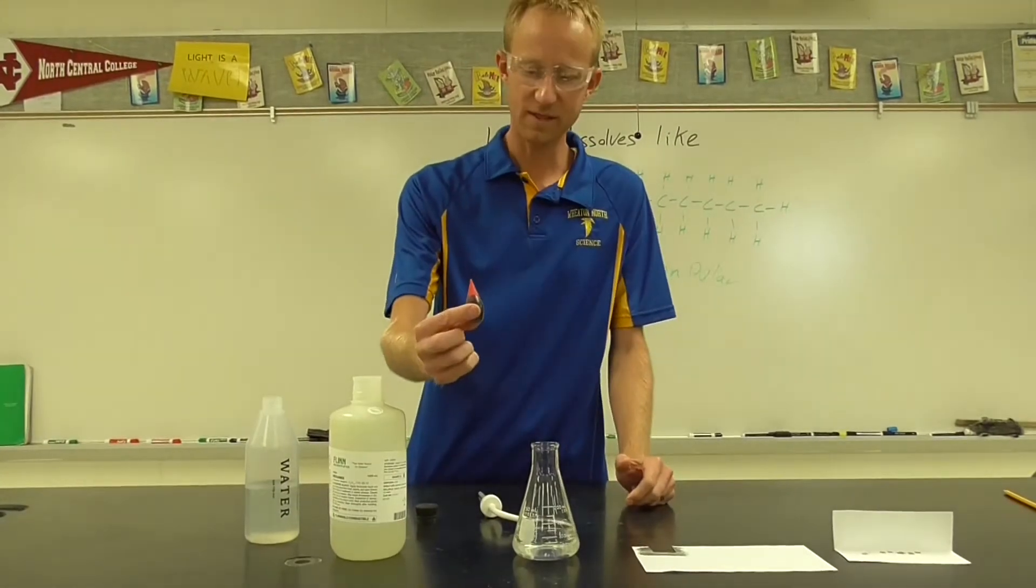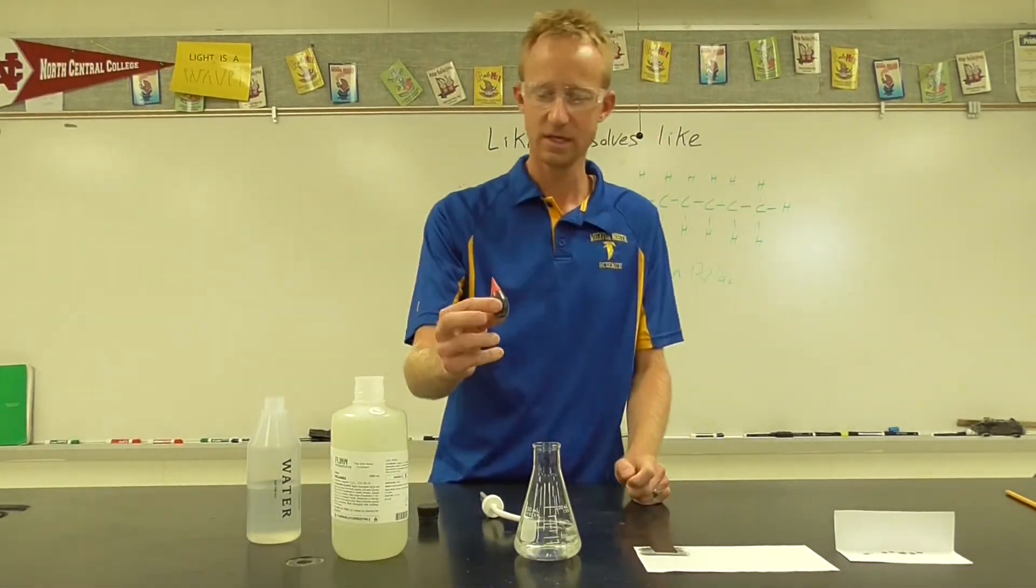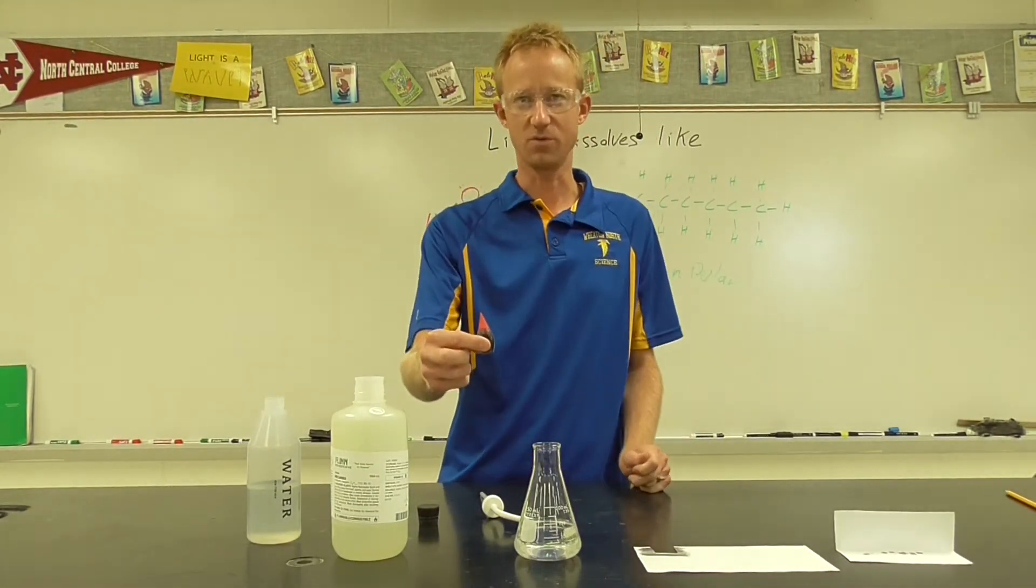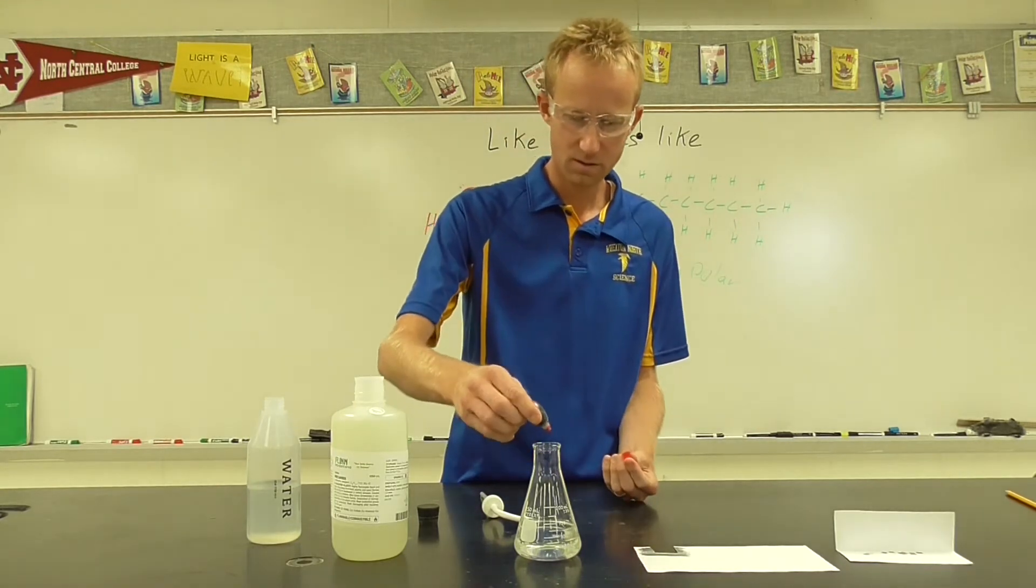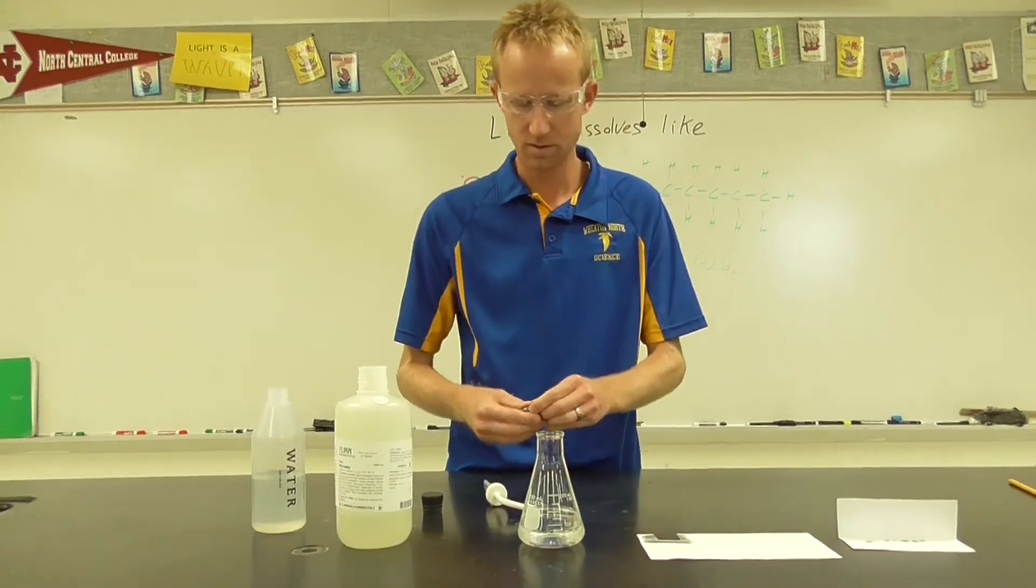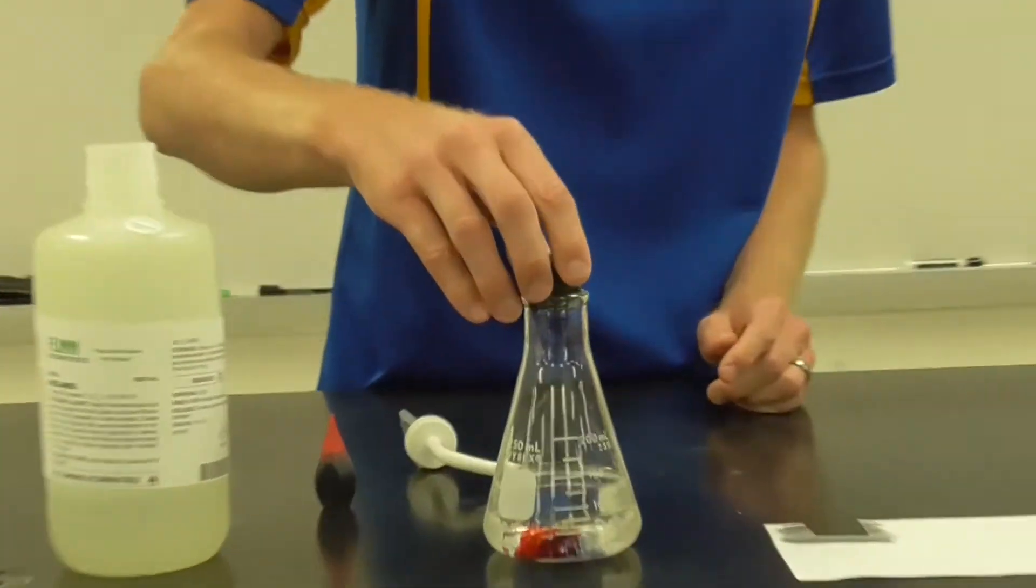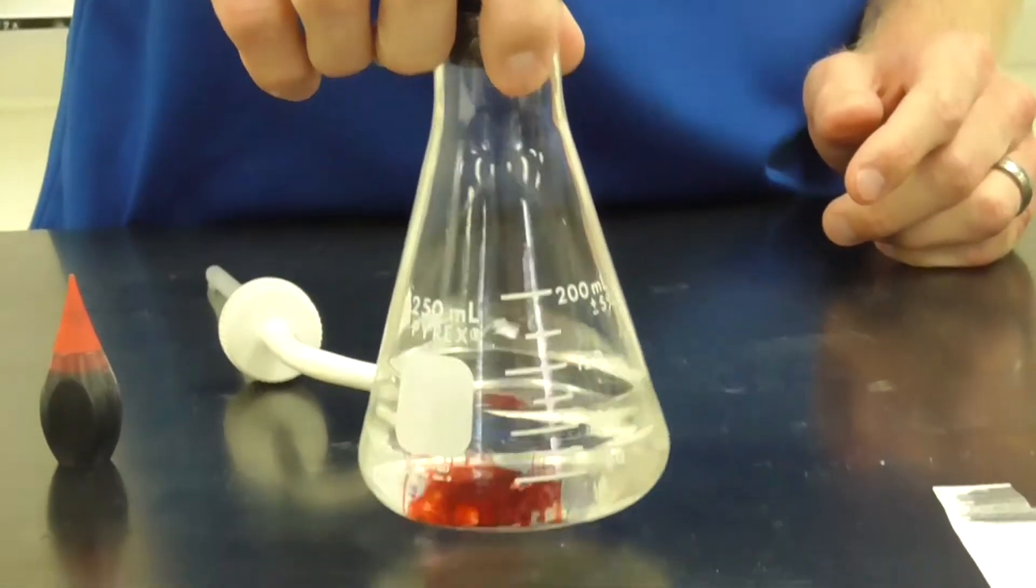Now, food coloring. Do we think that's going to be polar or non-polar? In other words, will this food coloring dissolve in water, or will it dissolve in hexane? If you noticed, that fell right through the hexane.